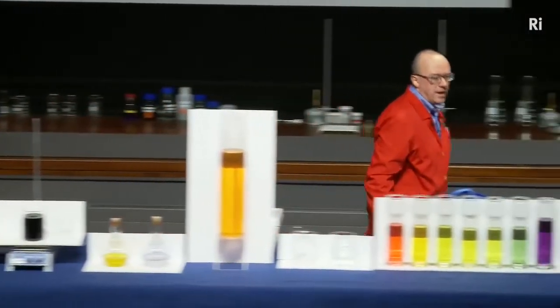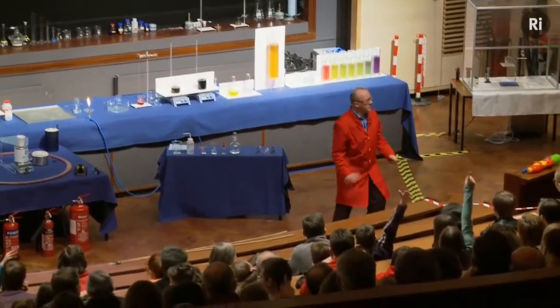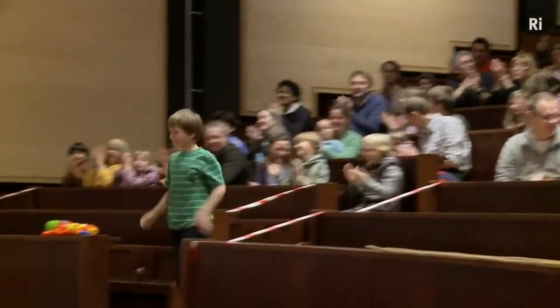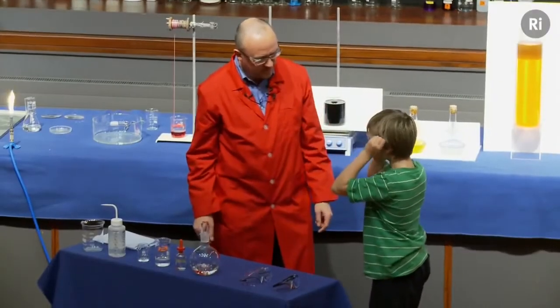So let's have a look at another reaction that involves a change of state. And for this, I'd like a volunteer, please. Who would like to volunteer? You're very keen. Come on down. Let's have a big hand for a volunteer. Who would like to stand there? Just pop those on. What's your name?